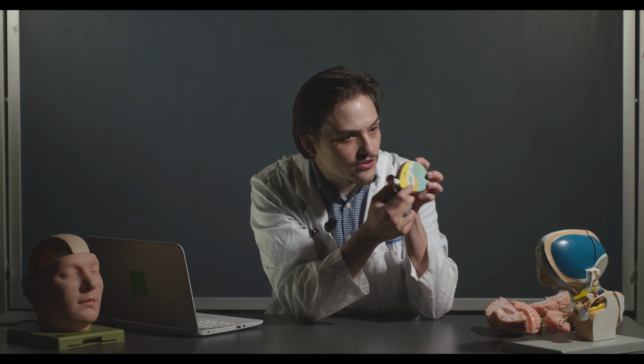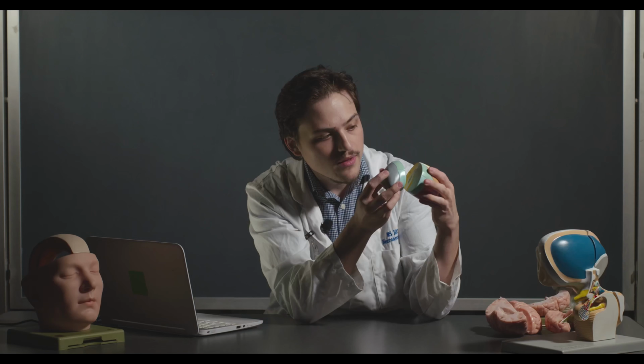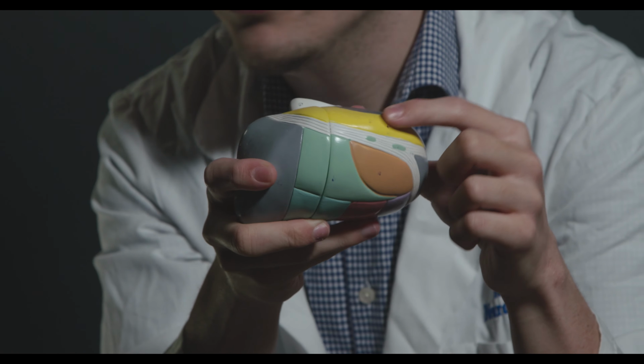And there's also another nucleus called the ventroposteromedial nucleus, the other half of it, which you can actually just see on the inside here once we take it apart. Then this guy back here is the pulvinar, and then up here we have the lateral dorsal nucleus, and then here we have the medial nucleus.